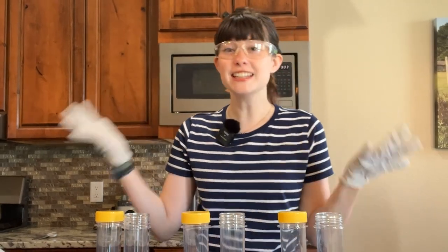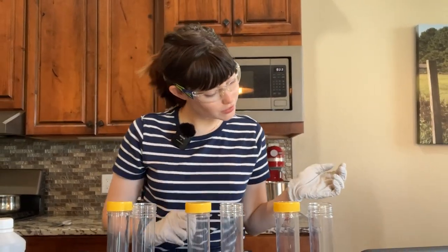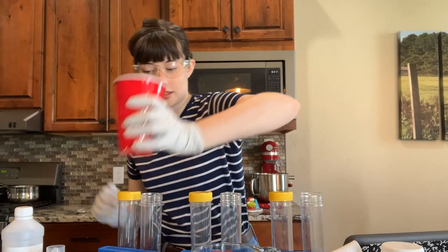But before I can start filling these, we have to safety up. All right, I'm safetied up. Now I can start filling them. Lab safety is always the most important thing.